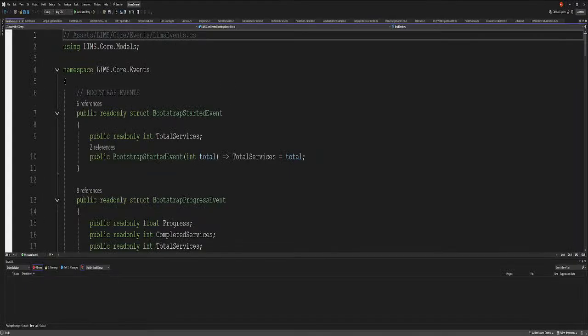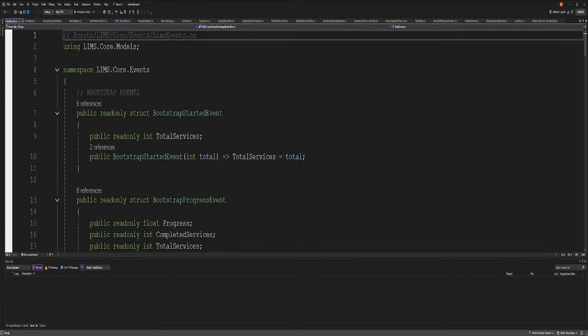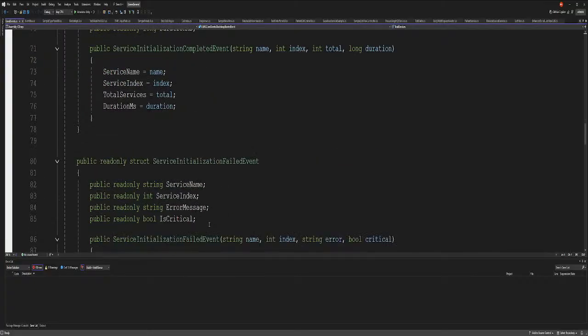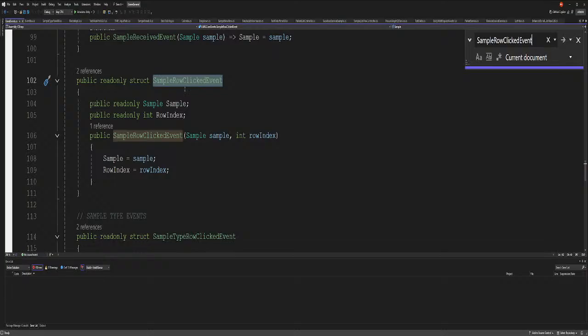All right. Can you guys see the screen? Yes, you can. So this is our LIMS events. Okay, so we got bootstrap events, bootstrap failed events, service events, and then we're supposed to have, let me look at my notes, a sample row click event. There we go. So in the LIMS events, we have a sample row click event, right?